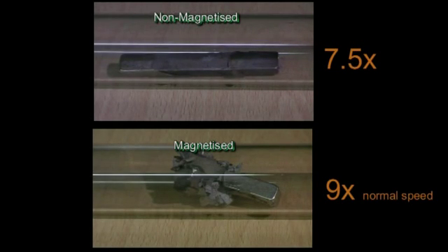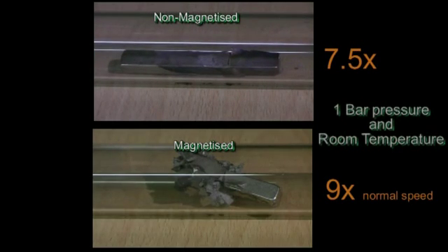The magnets are now loaded up into glass tubes with high purity hydrogen from our electrolyser flowing over them.